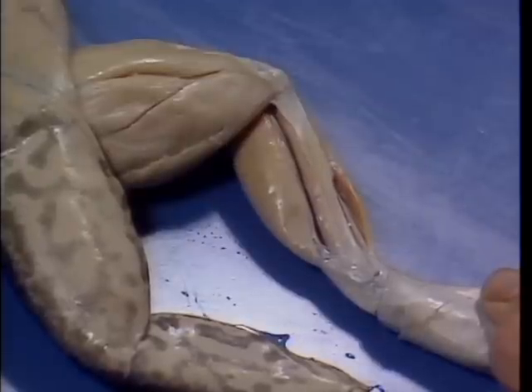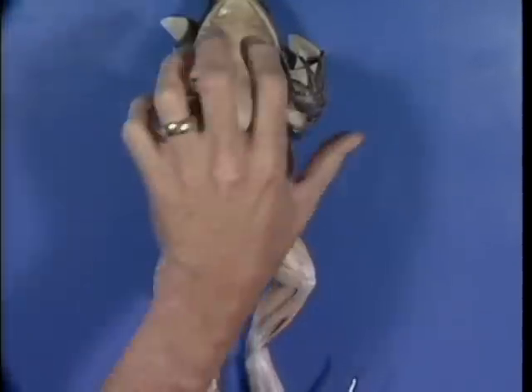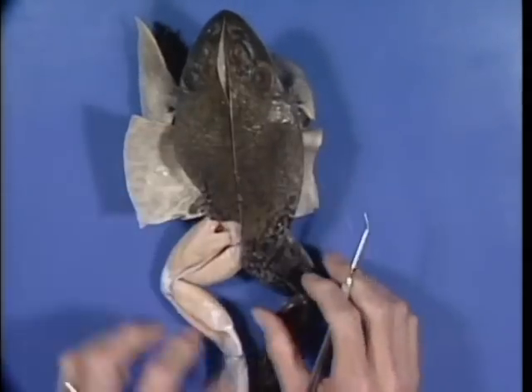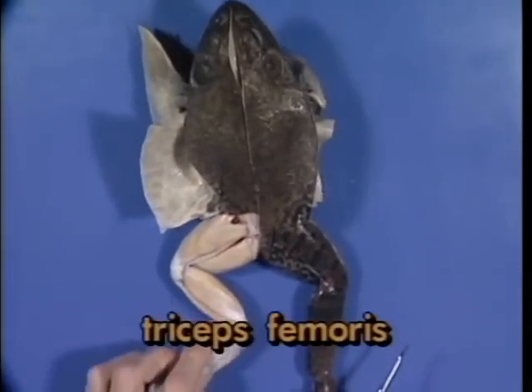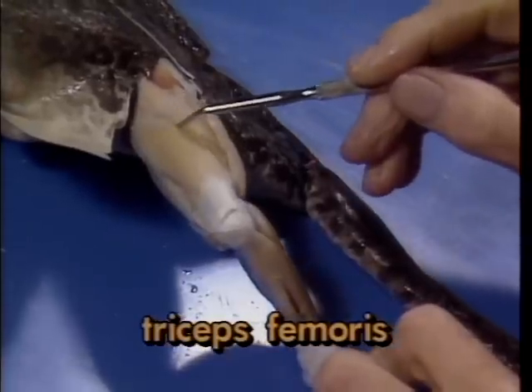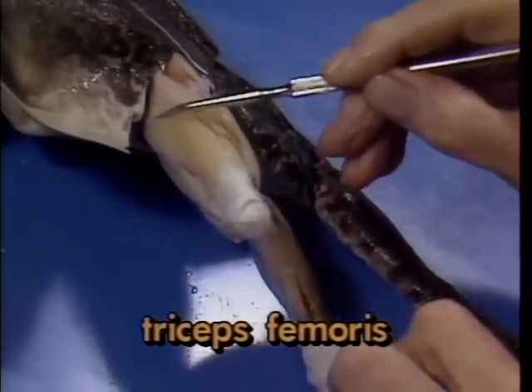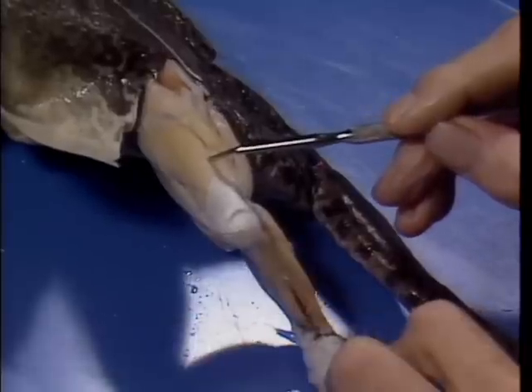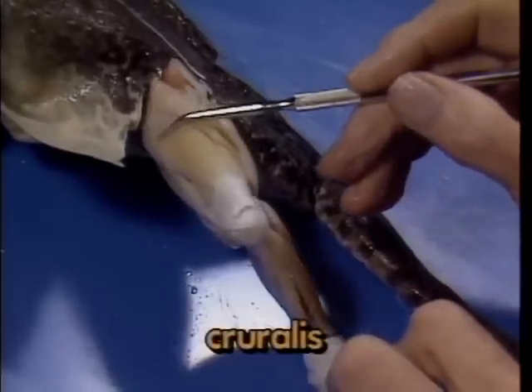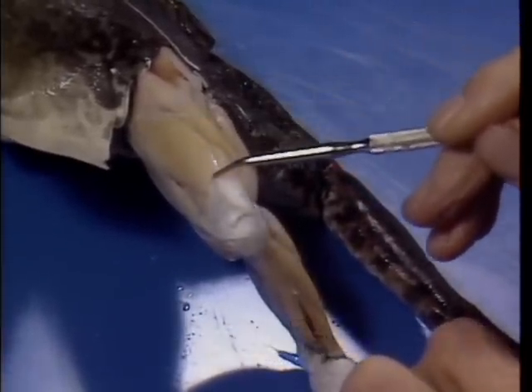In order to examine the dorsal muscles of the hind limb, pull the skin away from the rest of the thigh and lower leg. Again, note the triceps femoris, visible on the lateral surface of the thigh. All three muscles of this complex are visible here. The first element, the cruralis, lies along the anterior margin of the thigh.